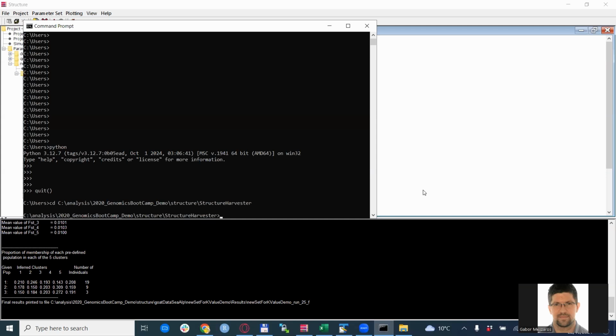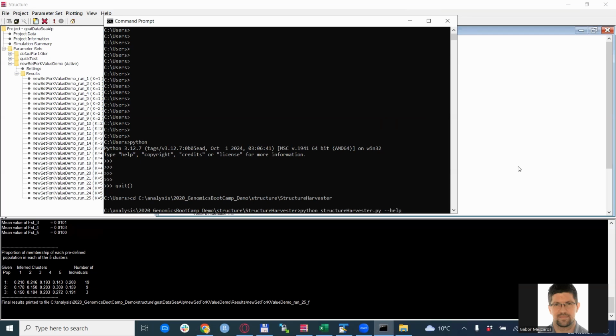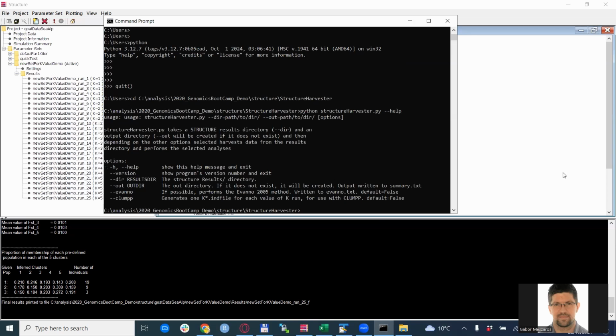So you have Python installed and you have downloaded the structure harvester Python script. What you need to do is navigate to the place on your hard disk where the structure harvester script is located. For me, this is this directory, but of course for you it is something else. In Windows you use cd, for change directory, followed by a space and the path to the actual directory. To check the options, and also to check that the structure harvester script runs properly, I would suggest using this first command: python structureharvester.py --help. That prints some text with descriptions of how to use it, which is exactly what we discussed before.